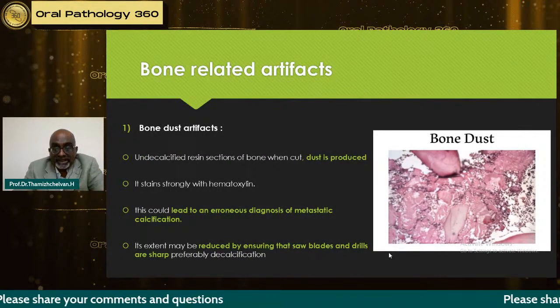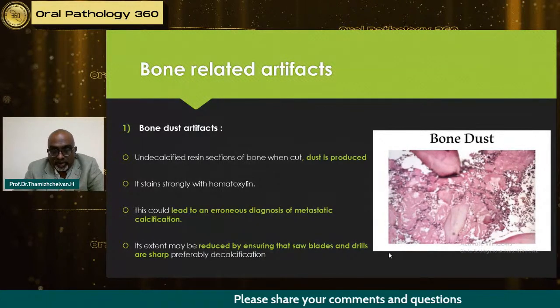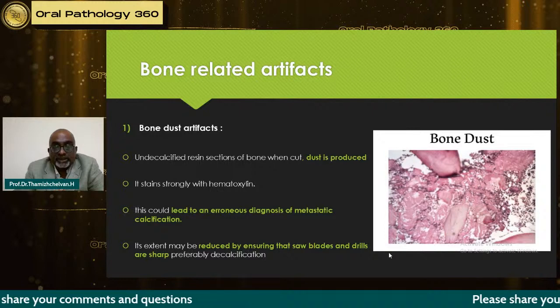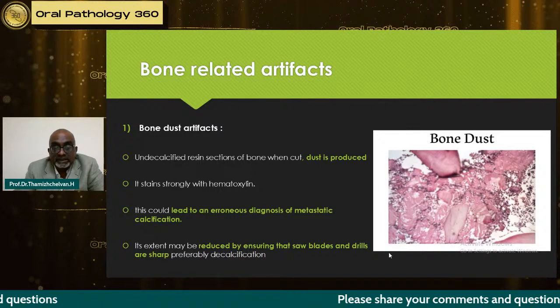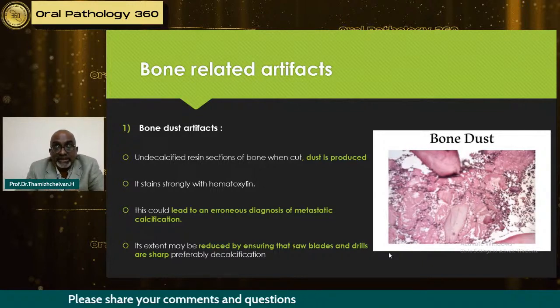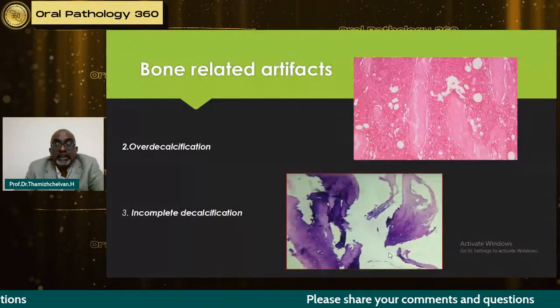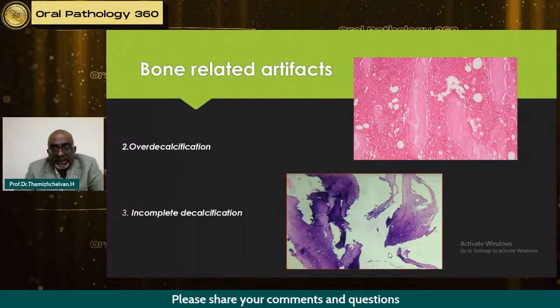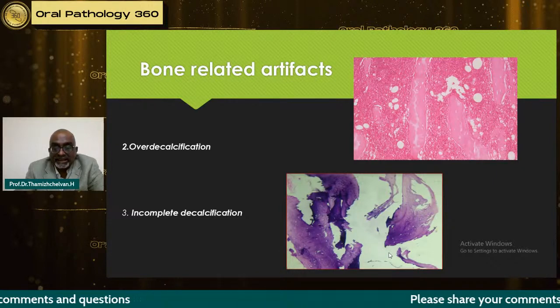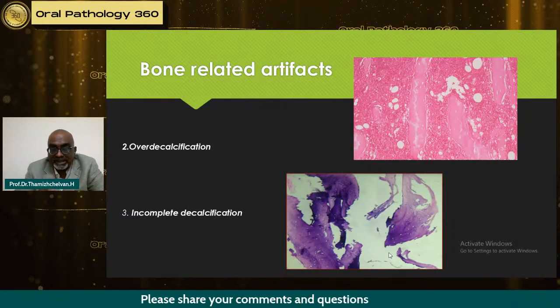Bone related artifacts. When you get bone specimens, we take the bone for cutting under the saw. If the saw is not properly cleaned or not properly sharp, you have bone dust getting deposited, and this could lead to an erroneous diagnosis of metastatic calcification. So this can be reduced by ensuring that saw blades and drills are sharp, preferably decalcifying. And decalcification has its process; either over decalcification or incomplete decalcification can also give problems. When you put a solution for decalcification, check every day so that it can go to the correct stage for cutting.